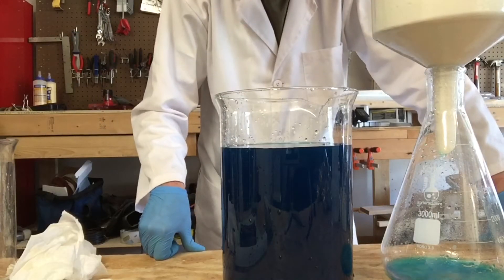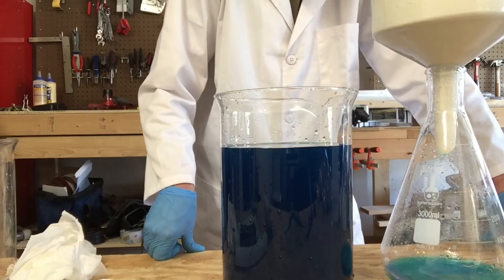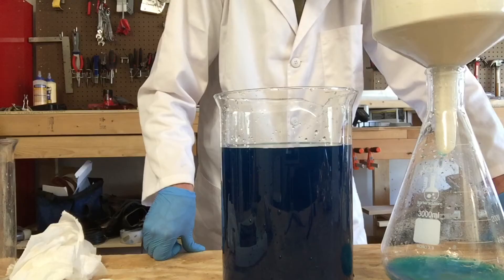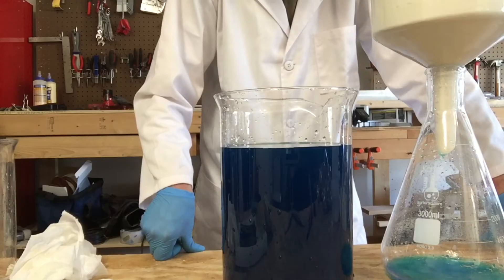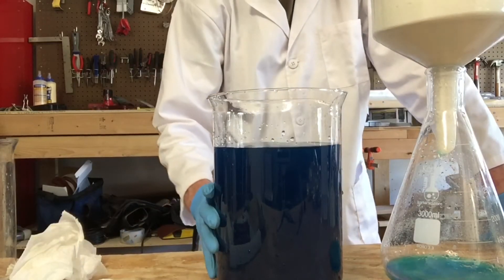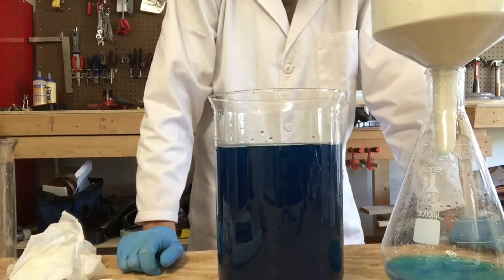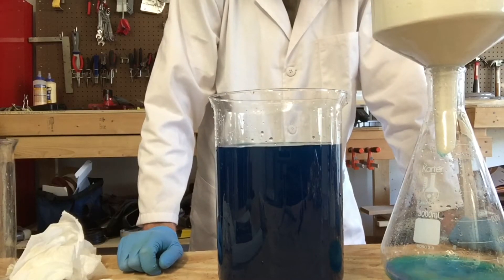Our silver is just about done filtering out. I'm going to rinse this out really good to get any of that green stuff left over from the copper off, and then we should be left with pure silver. Now what a lot of you might be thinking is: what about all that copper that's in solution now? We're going to be getting that out also. I'll let this finish so I can get all of our liquid back in here and then I'll show you how to do that.